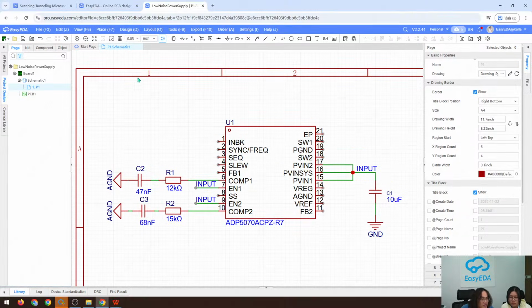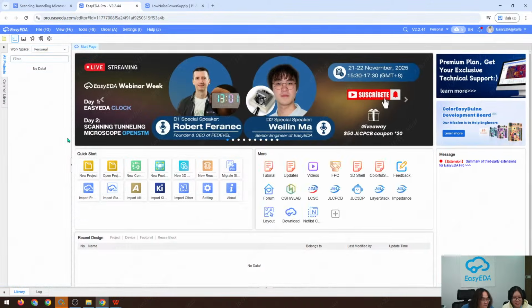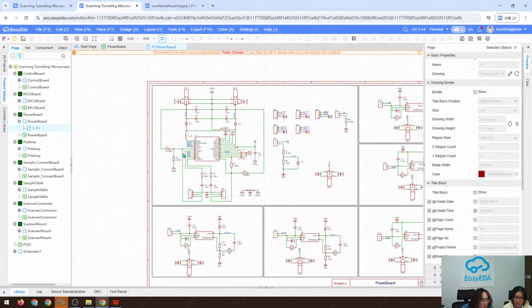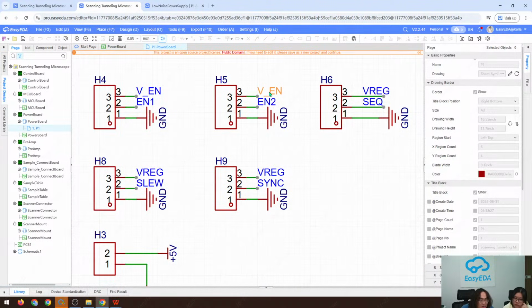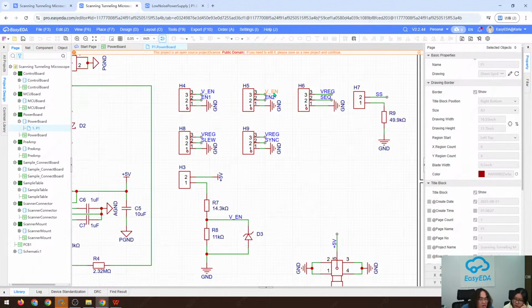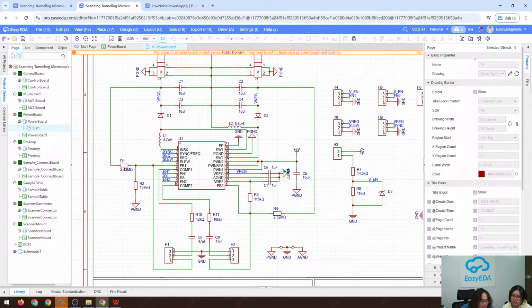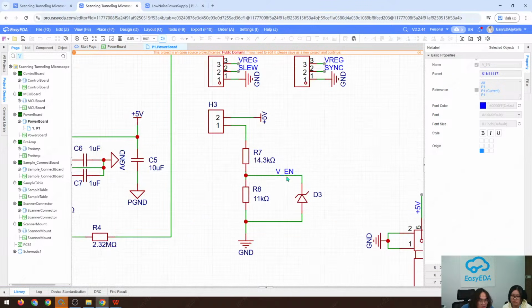Maybe let me remind myself of my previous design. It's the power board. The enable here, what are we going to connect? It can be set to ground, or it can float. Actually, I think it can float. We enable it from here.